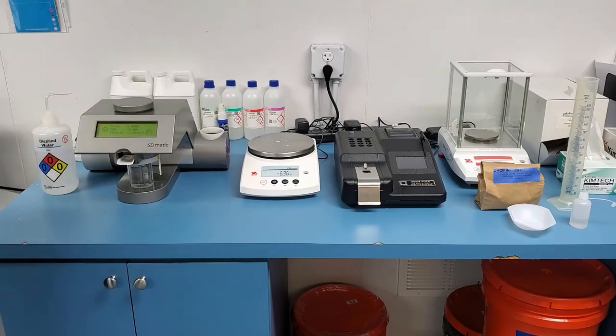Enter in the flour weight — it is 1 gram of flour, plus or minus 0.01 grams. Since we were at 1 gram, we would leave it. You will have a hydration basis and a protein value of the flour. Once all that information is put in, all you have to do next is press test and the device will start.